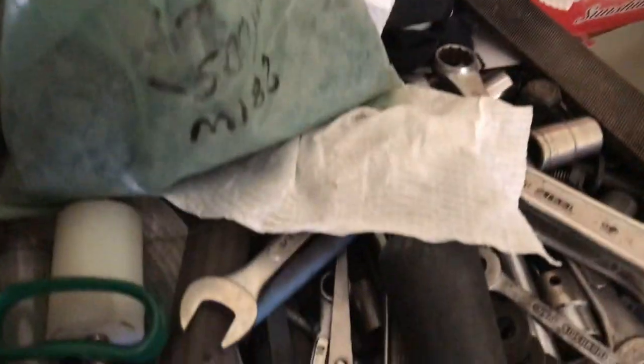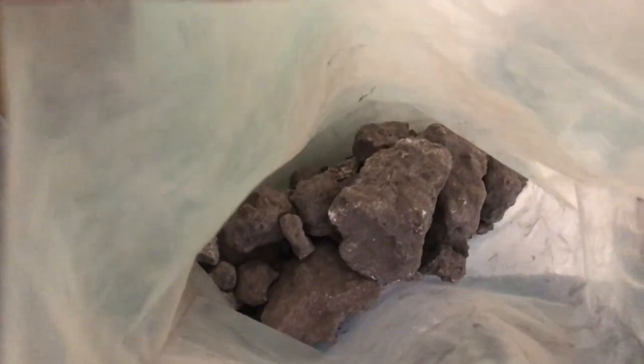Today I'm making some graphite oxide. I have a 50 micron 95% graphite in powdered form, and I also have some 500 micron which is around about 15% graphite in a different form. I also have larger chunks which are also about 15% graphite — conductivity on those rocks isn't that good, but I'll do a conductivity test on my little test sample.